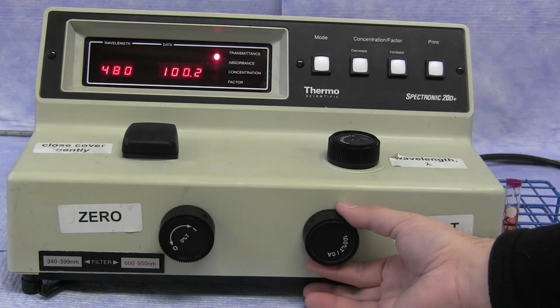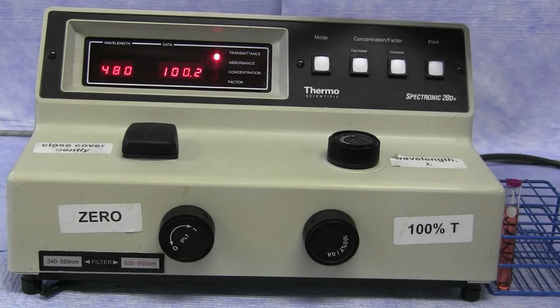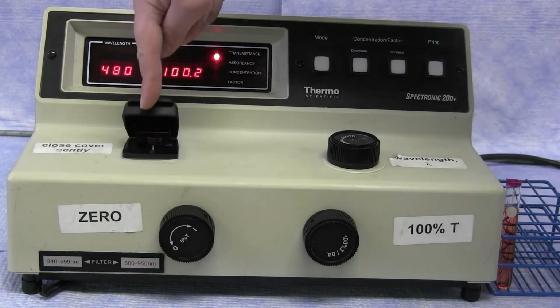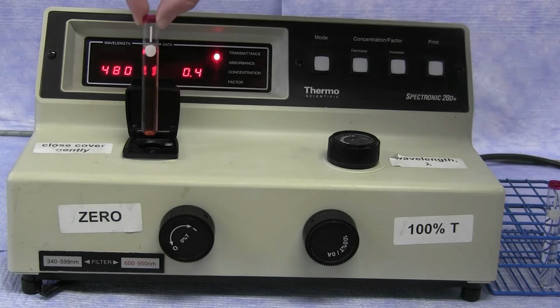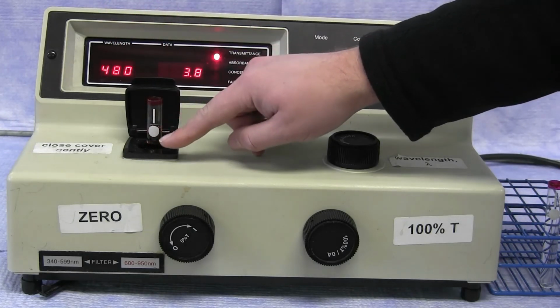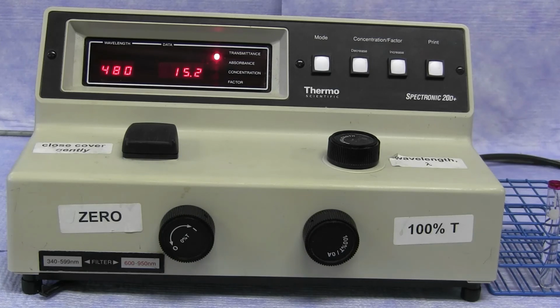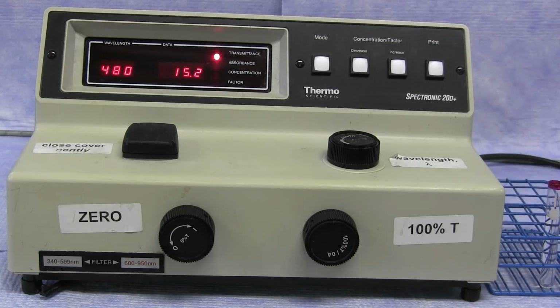So any absorbance that's coming from water itself can be corrected for. There's usually a small amount of drift associated with the actual value, so plus or minus 0.2 for the calibration and measurements is acceptable. You can then remove your solvent cuvette and place your sample cuvette inside, again making sure that the markings are lined up on the spectrophotometer. When this is done, you can then record the percent transmittance of this particular sample. The percent transmittance can then be converted into an absorbance for you to either determine concentration or molar absorptivity.